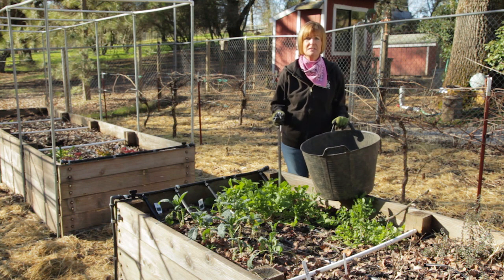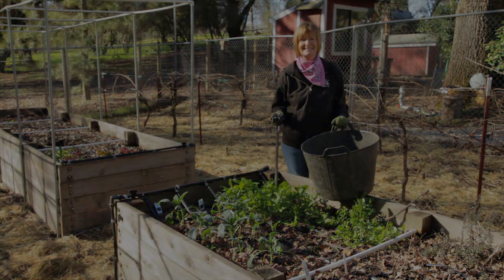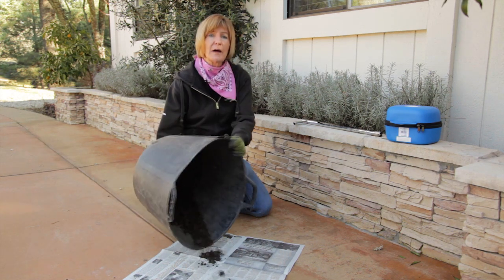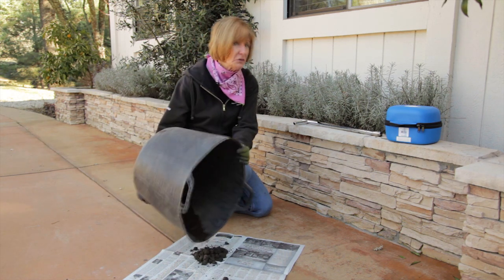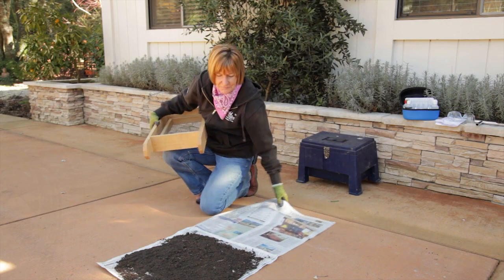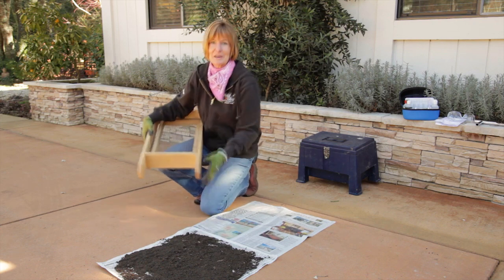For example, I'm going to do a separate soil test for each one of the raised beds. Spread the soil out on a sheet of dry paper and let it dry for about 12 hours. Don't try to hurry it along by putting it in the oven. My soil is dry, and now it's time to start my test.